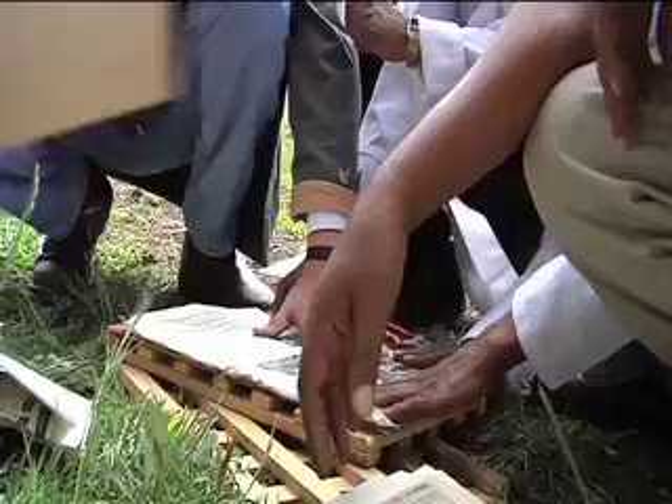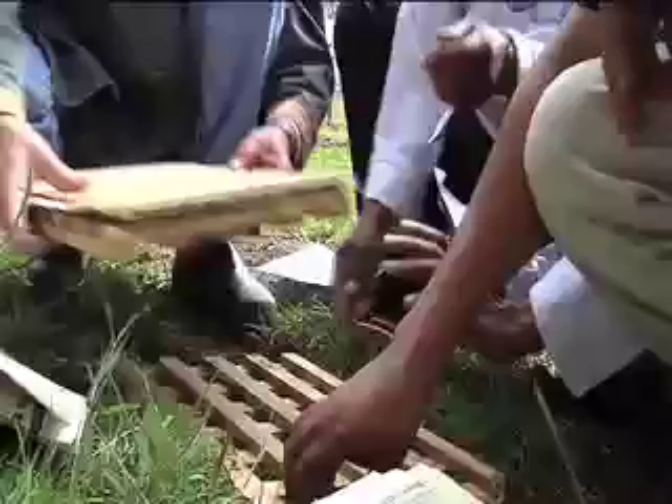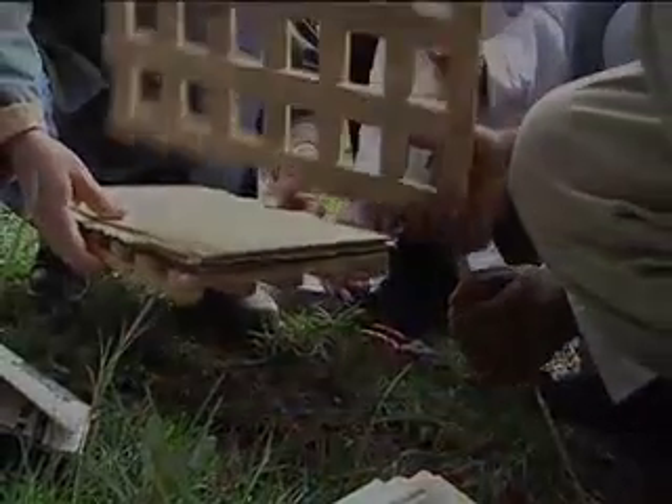When we finish, we will put this one in and bring that one — not this one, this one. That will complete the assembly. Let's take a look at it.